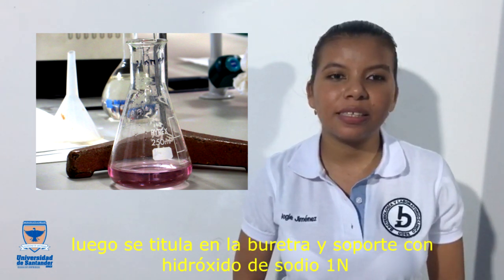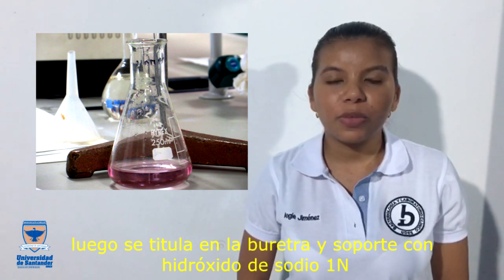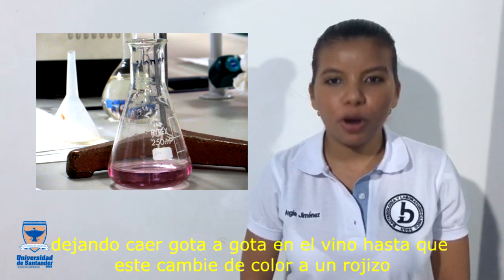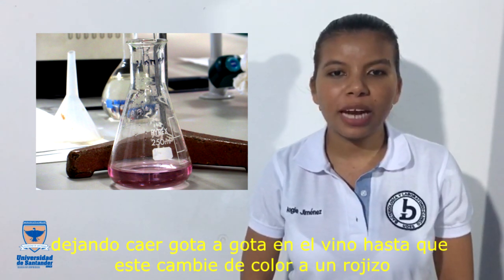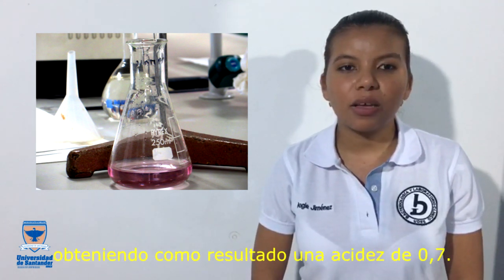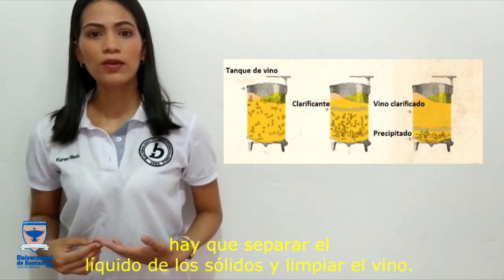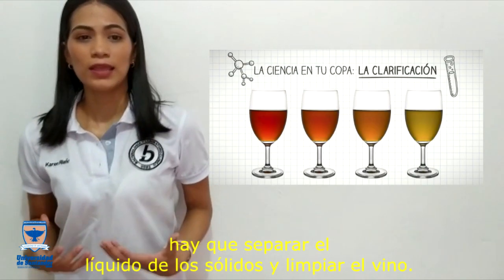It is titrated in the burette with sodium hydroxide, normal 1, dropping drop by drop into the wine until it changes color to a pink color, obtaining an acidity of 0.7. After fermentation has finished, the liquid must be separated from the solids and the wine must be cleaned.